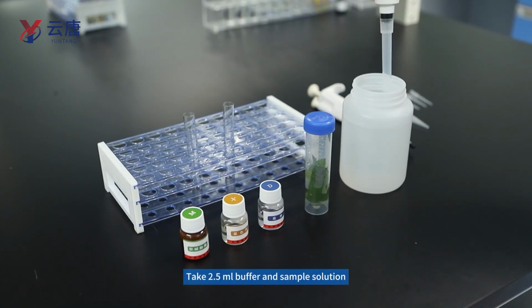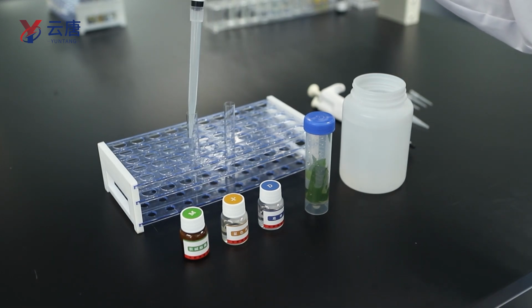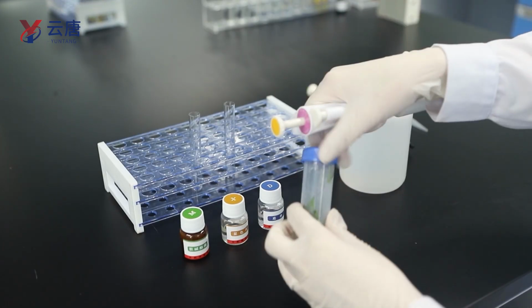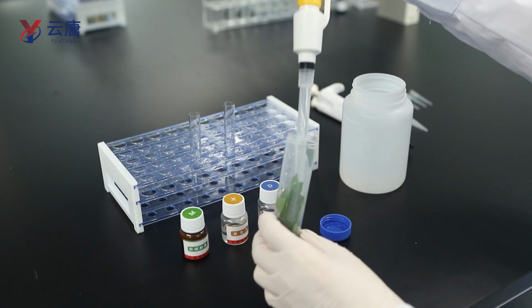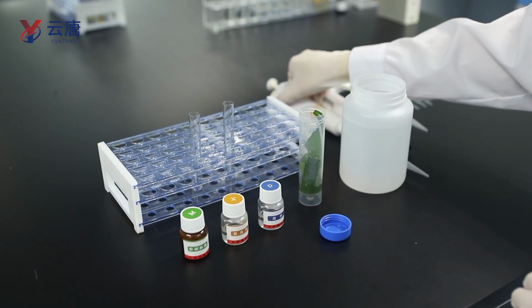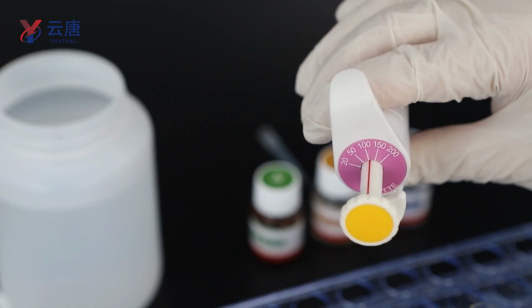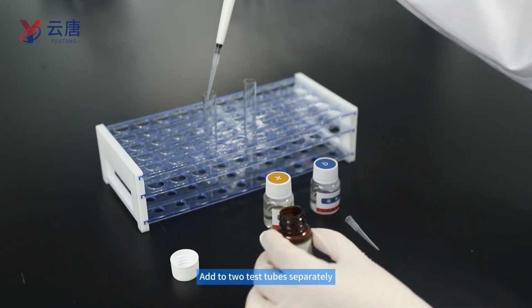Take 2.5 milliliters buffer and sample solution. Add to 2 test tubes separately. Take 100 microliters of cholinesterase. Add to 2 test tubes separately.